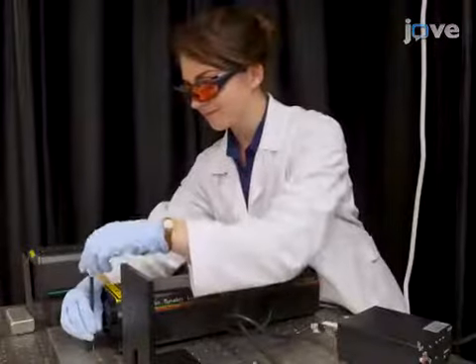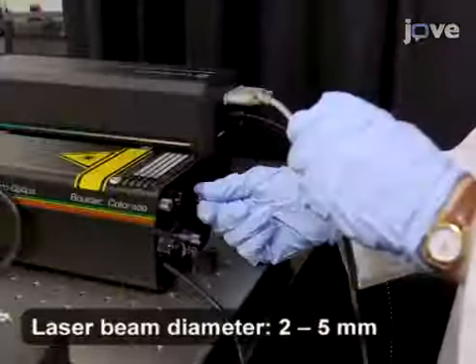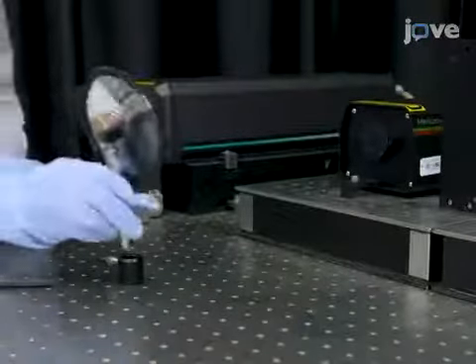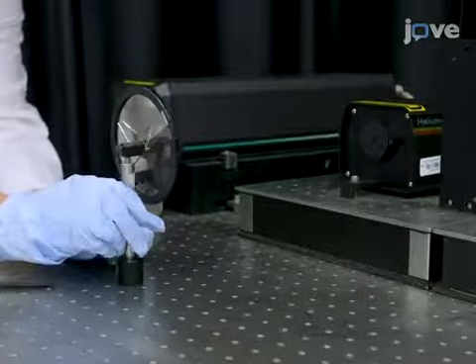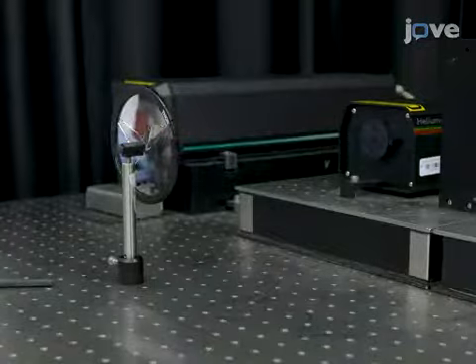To begin, secure a helium neon laser near the back left corner of the optical workbench and connect it to a power source. Place a neutral density filter between the laser and the sample location so that the laser beam travels through the filter before reaching the sample.